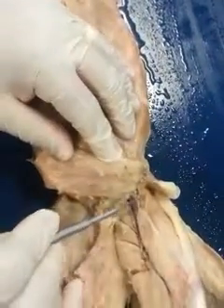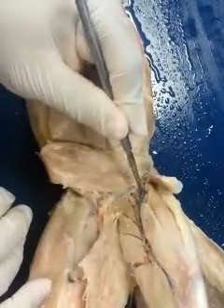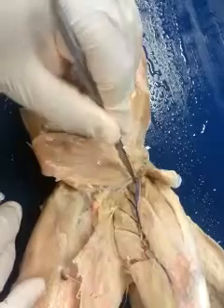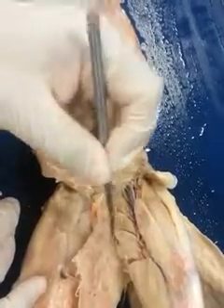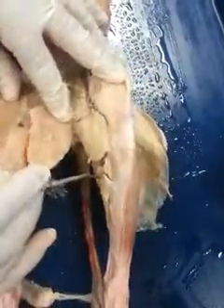The last muscle here would be a very deep muscle. Right there, you can kind of hopefully see it right where the probe is. That's going to be the iliopsoas. So iliopsoas, pectineus, adductor longus, adductor femoris, semimembranosus, semitendinosus. Let's move down to the crural region.